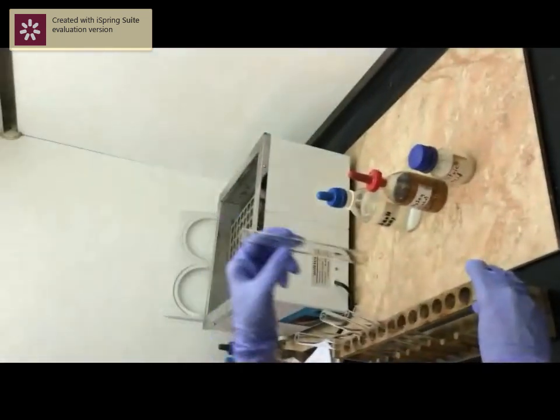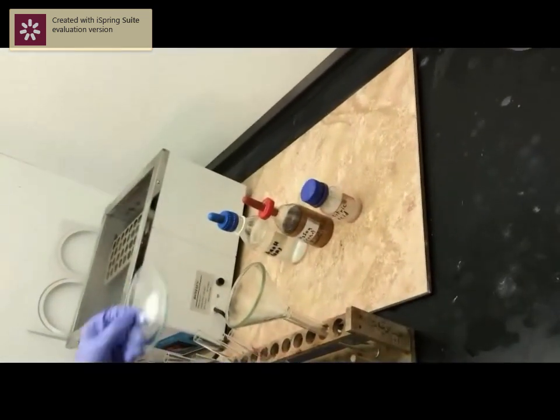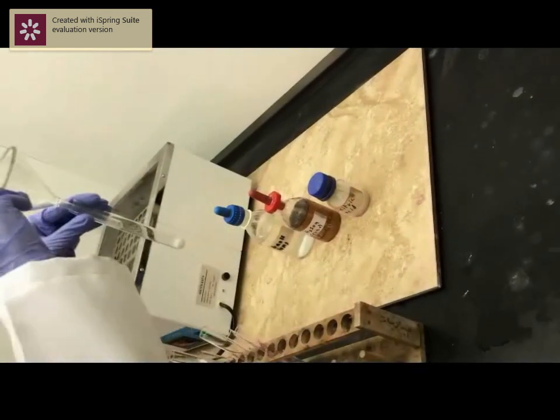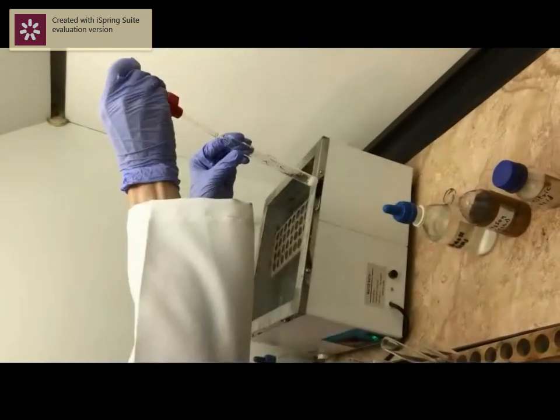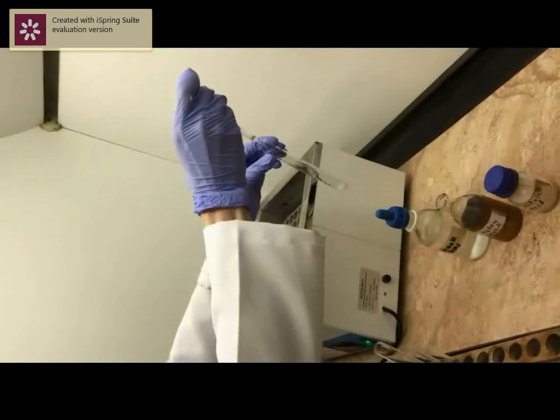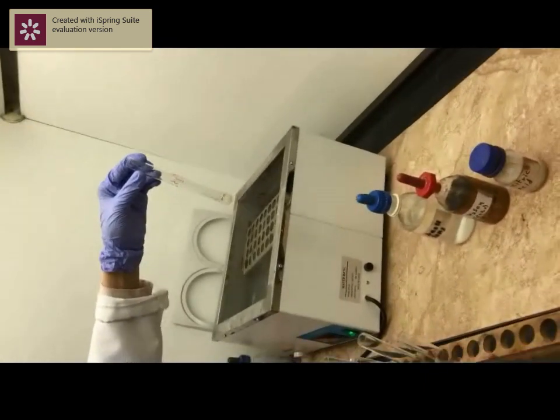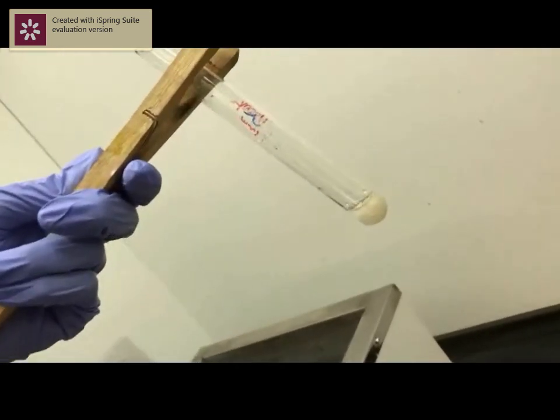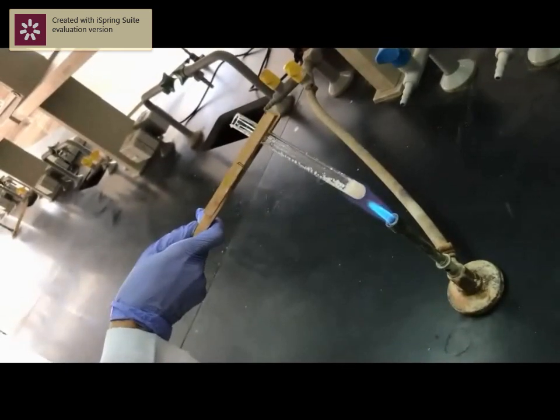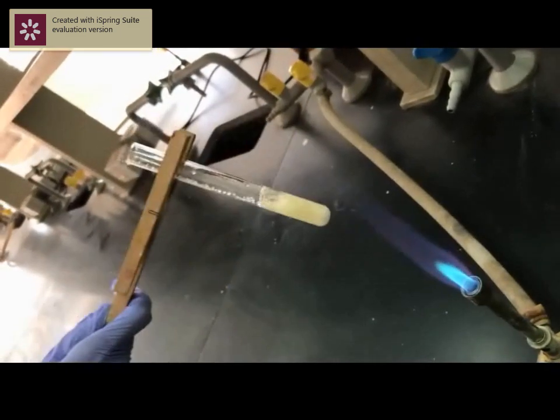To start with, bring a clean test tube and add 0.5 g of citric acid. Now add 1 ml of concentrated sulfuric acid. Then warm the mixture for one minute to identify the carbon monoxide formation. Warm and watch the air bubbles and the change in color to yellow.